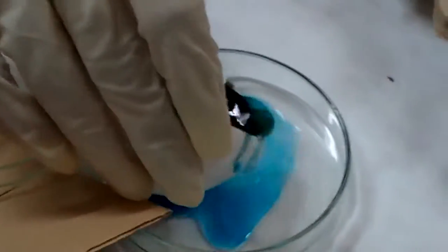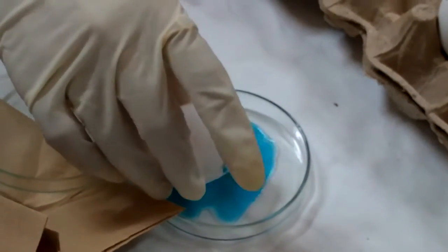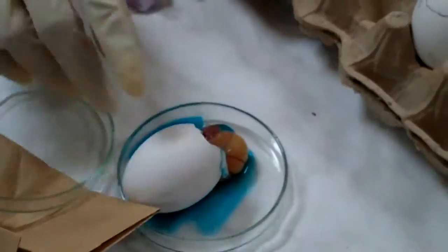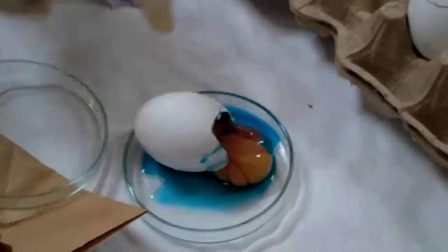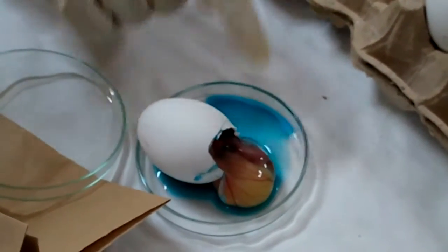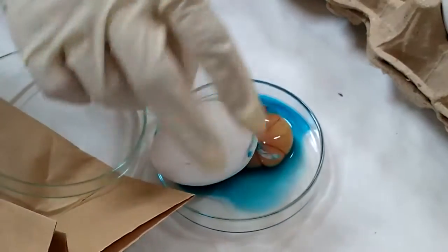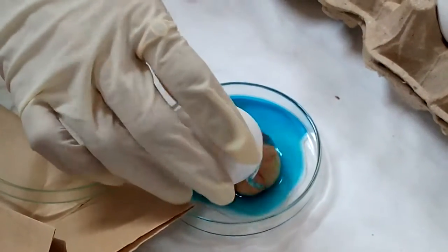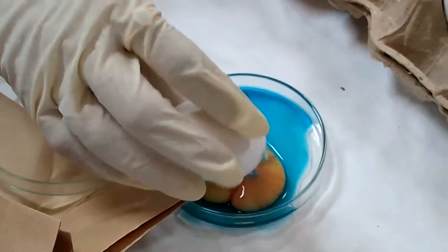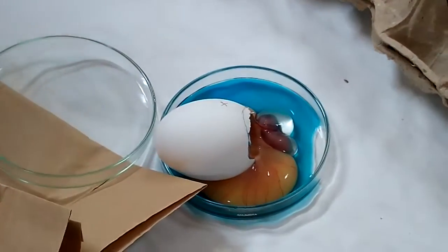We take this out and see. This whole thing is allantoid fluid and you can see the embryo sac is coming. When we inoculate in the embryo sac — or when we do amniotic inoculation — this fluid should be colored so that you confirm you are in the right cavity. And then you have the yolk sac. This volume is close to 8 ml and you can see there is still a cavity intact.